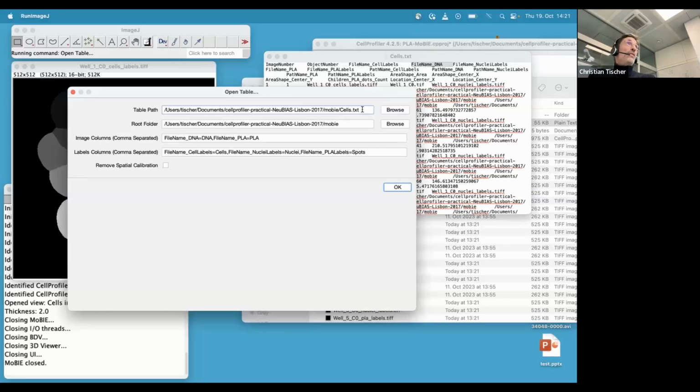Now, the column that I use in CellProfiler for finding where the images are, are in fact the file name columns. So they are pure file names without any folder, and that's why here is this additional field which is called root folder. So you have to give it the root folder of all the images. So that means the table can be anywhere, but with the current implementation, all images, input and output data have to be in the same folder. Otherwise, this logic doesn't work.